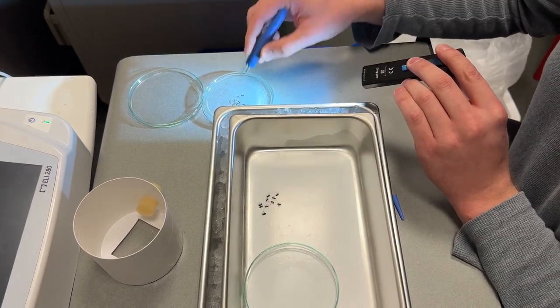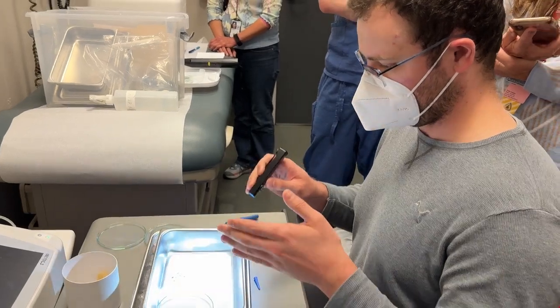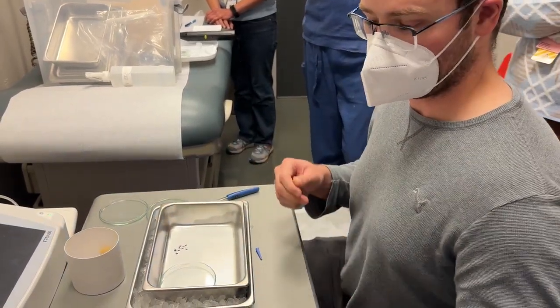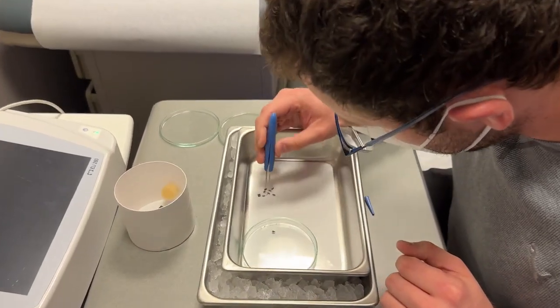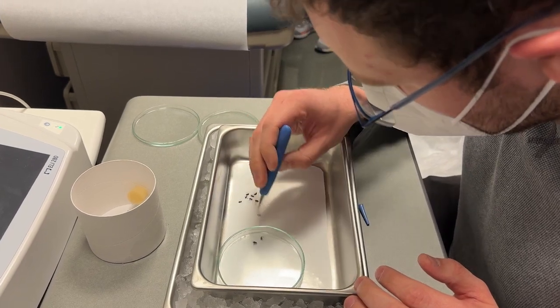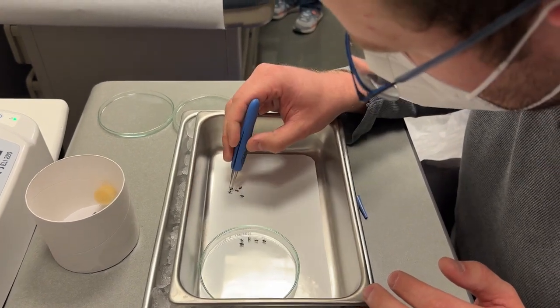The important part here is that because we're in a clinical setting, our goal is to account for all mosquitoes that come in and all mosquitoes that go out. I need to have a tally of how many are in each cup and how many I'm killing for each group, because we don't want any mosquitoes flying around. For additional safety reasons, that's also why the door behind Elaine is closed and why there is an electric fly swatter on hand, on the off chance somebody decides to take a flight.